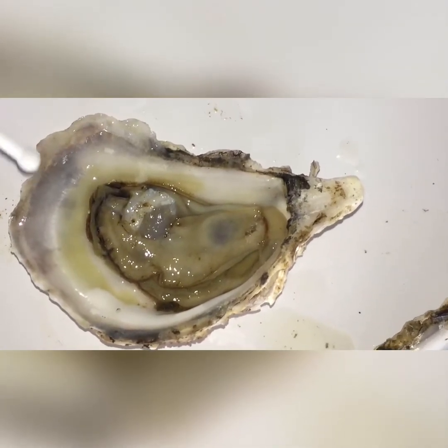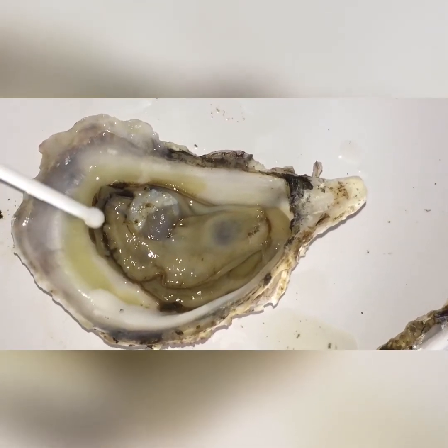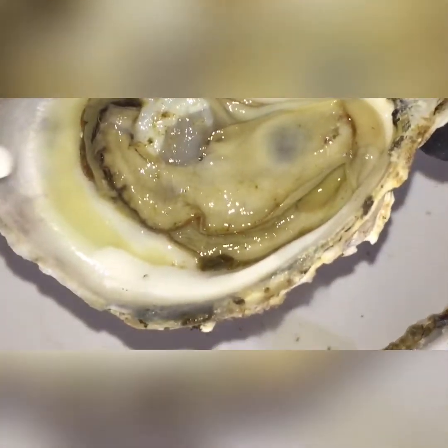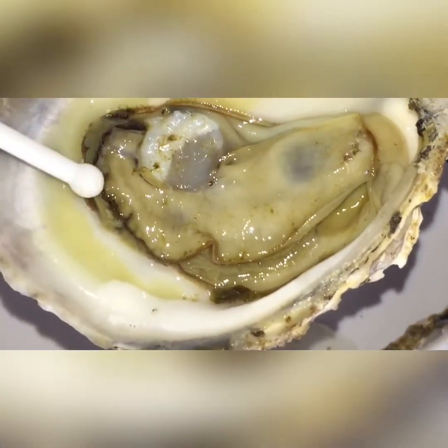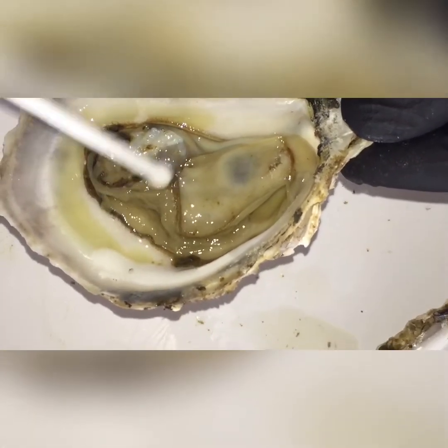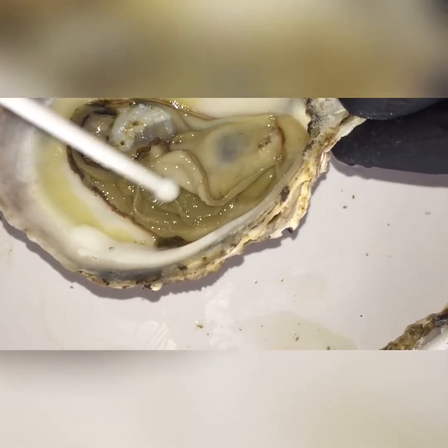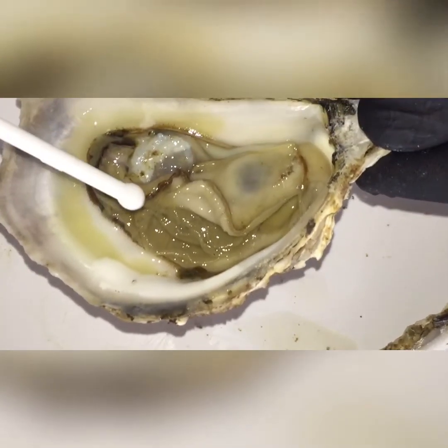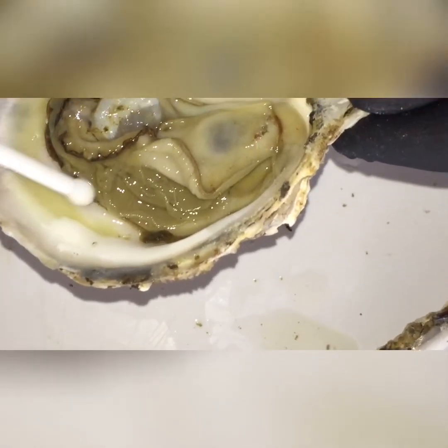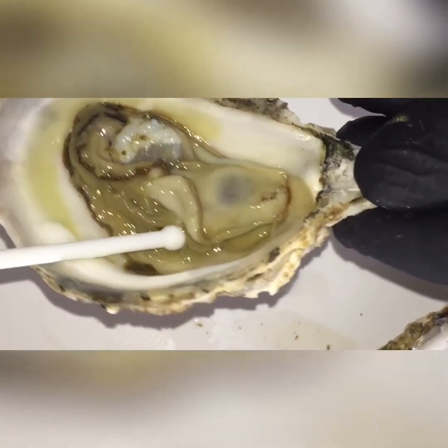Along with the food particles, they'll also bring in the dirt that's in the water — which explains why you see how this is really brown. That's because of the dirt. So it transports the food particles and actually takes them through the gills, because the gills have two functions. One, it allows the oyster to breathe — just as fish have gills, oysters have gills. It also transports the food particles from the gills into the mouth.